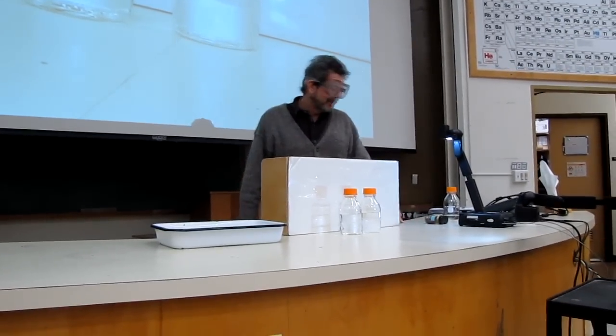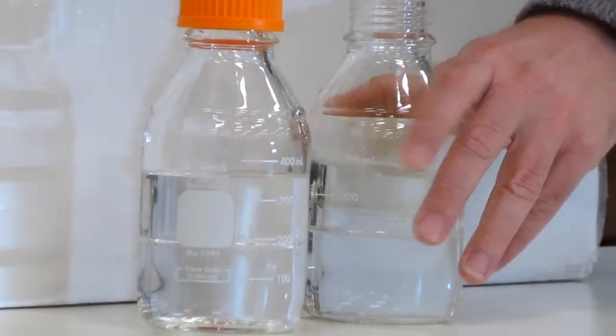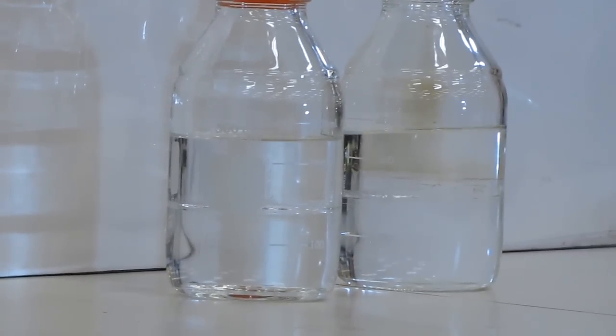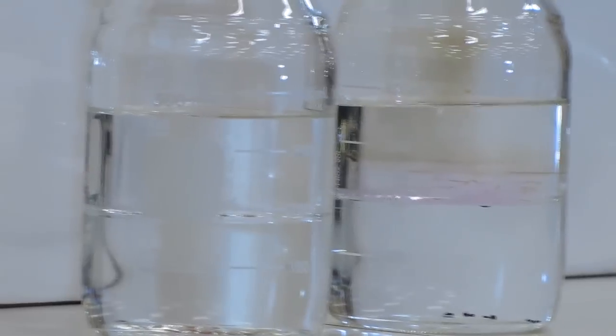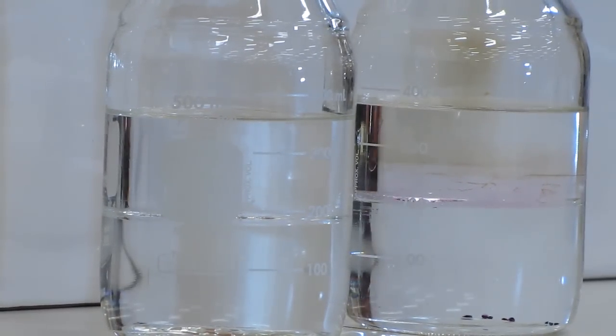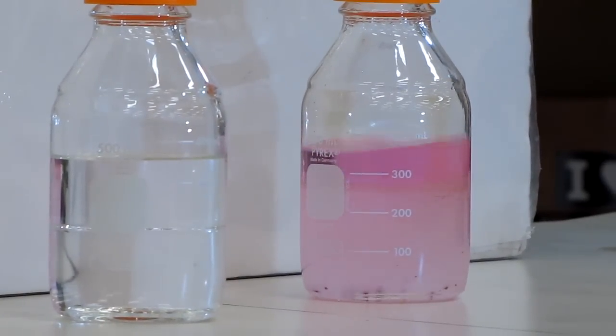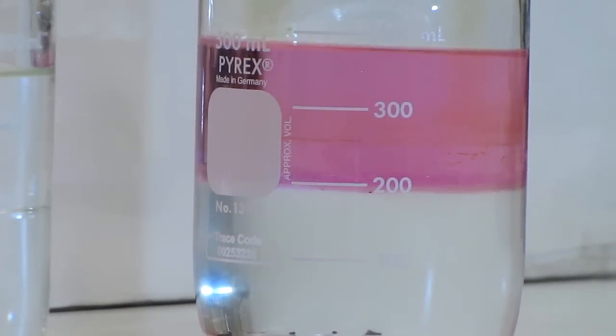Iodine. Someone says iodine. Okay, I heard iodine first. Let's take a little bit of iodine. Let's take a few crystals of iodine and drop them in there. Oh hey, cool. Some are floating on the interface. Let's do it. Cool. And let's wait for that to separate back out. Okay. So the iodine is not dissolving, at least not dissolving very rapidly in the water.